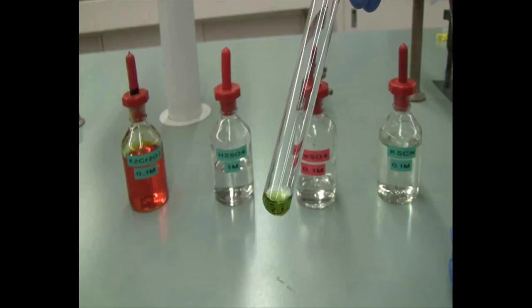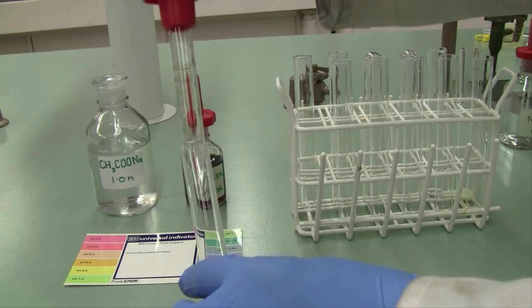In this week's experiment, you'll be looking at a variety of different chemical reactions, and you'll be writing chemical equations to explain what you see. There is lots of assistance for you in your prac manual, so make sure you make the most of this assistance. In the first section, we're looking at the acid-base properties of salts.